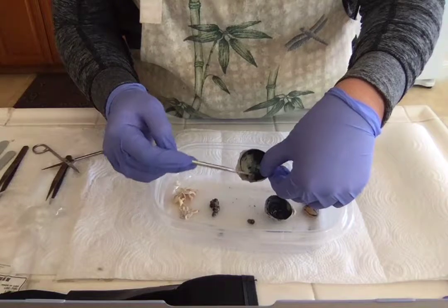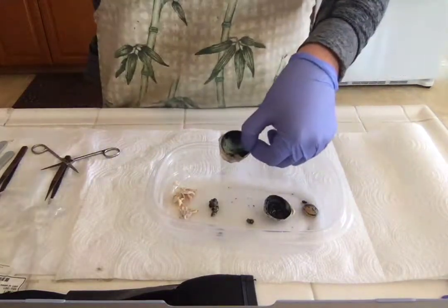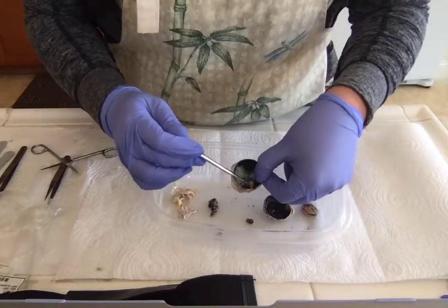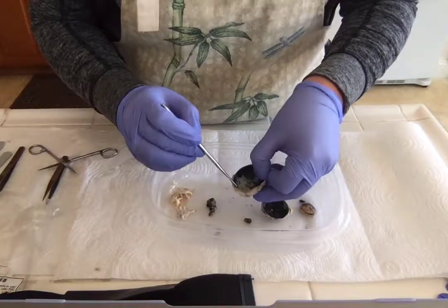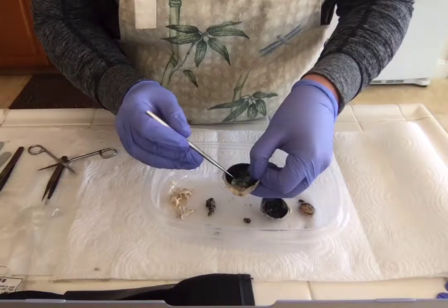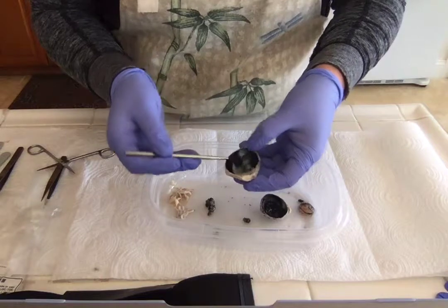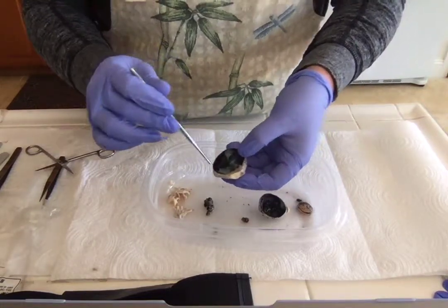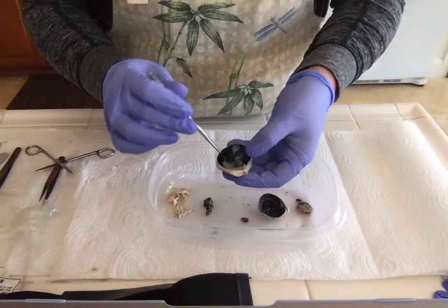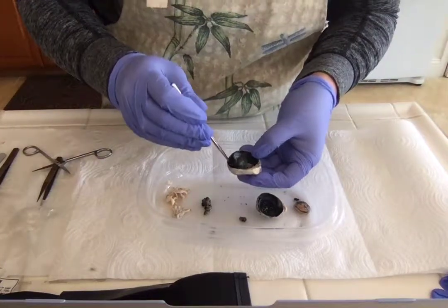eye. So this is the blind spot, which I thought was very interesting. It's a very small part, but it's the area with no photoreceptors. That's why it can't interpret those lights, the information. And also seeing the difference between, obviously, a cow eye, which has the tapetum lucidum, hopefully I'm saying that right, whereas we don't. This helps them see at night, which I thought was really cool as well.